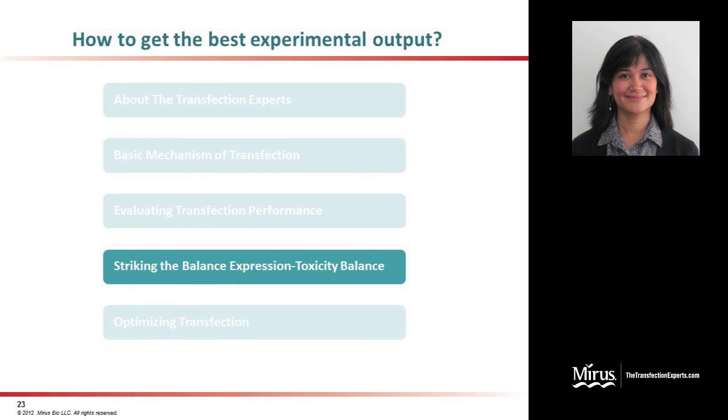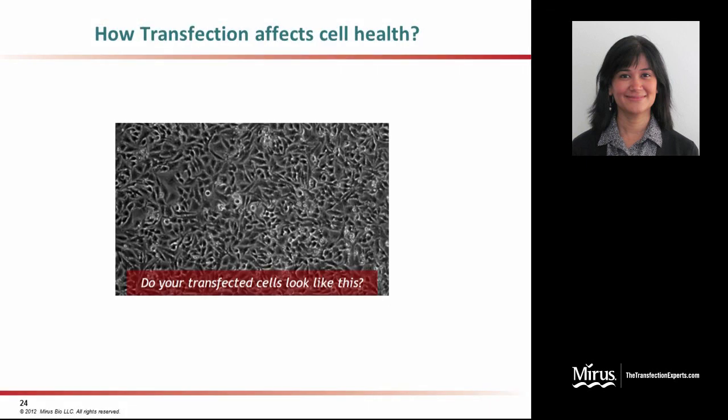If you recall from the earlier mechanistic slides about transfection, it is a highly membrane active phenomenon. There's a lot of endocytic pathways involved, and there's a lot of membrane reorganization within the cell following transfection. A harsh reality, therefore, of most transfection methods is the associated cellular toxicity incurred by these techniques. Here is an image illustrating how transfection can really affect cell health.